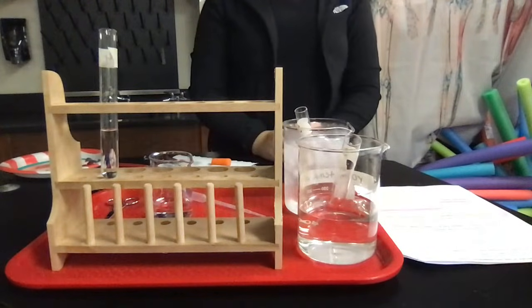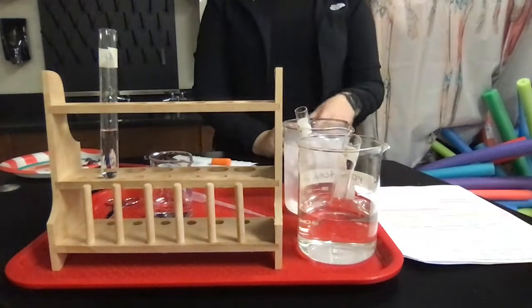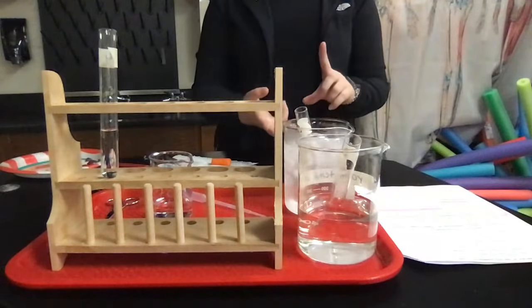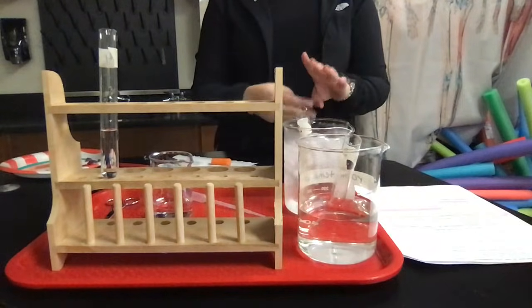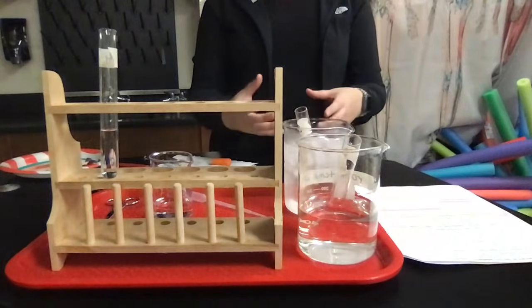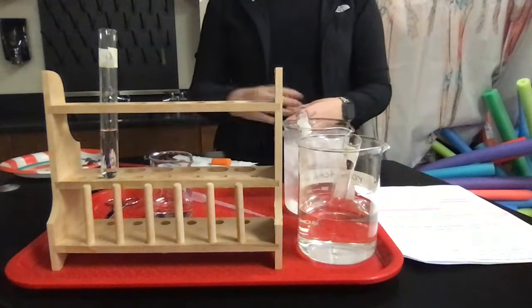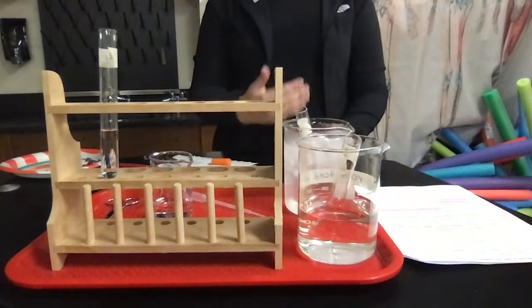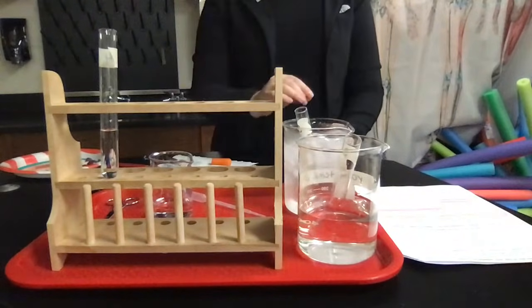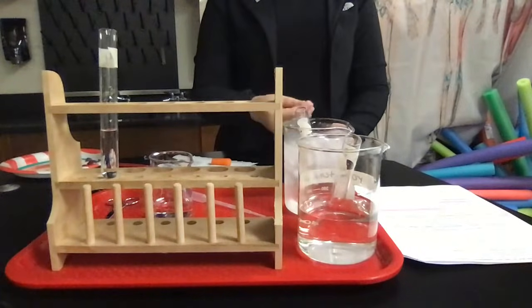Okay, so now we're going to start part 2 of this experiment, which is going to look at the effect of temperature on the catalase activity. In the first part, we proved that potatoes, carrots, and liver have catalase activity, which means that they contain the enzyme catalase, which catalyzes the reaction of breaking down hydrogen peroxide into oxygen and water. And then we saw that the catalase is reusable because if you took it out after a reaction was completed and you put it into a new tube with new substrate, which was the hydrogen peroxide, the reaction occurred again, which is exactly what you would expect.